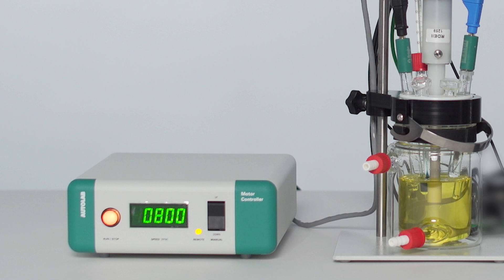This video will show you how to set up, use and care for your Autolab RDE.